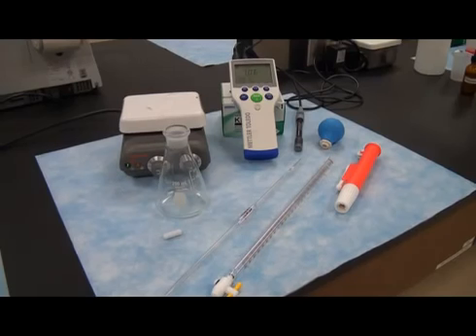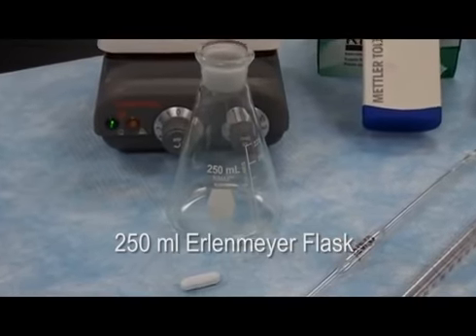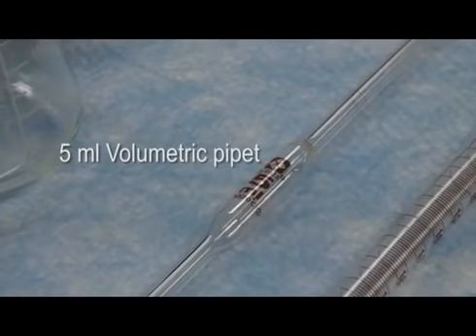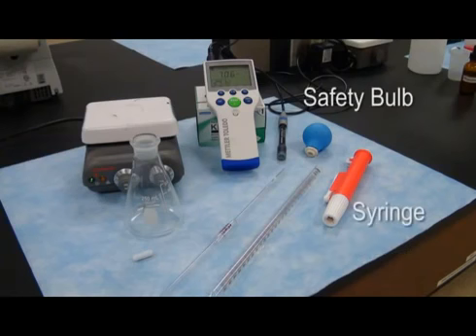The following equipment will be needed to measure the TA of a wine or must sample. Equipment: a 250 ml Erlenmeyer flask, a 5 ml volumetric pipette, a hot plate, a 10 or a 25 ml burette, and a pipette safety bulb or syringe.